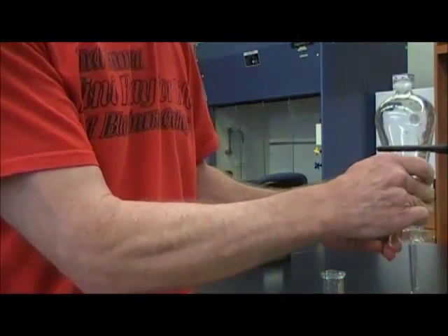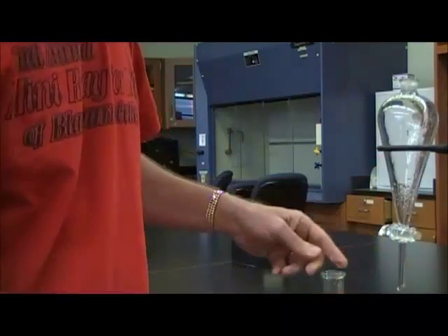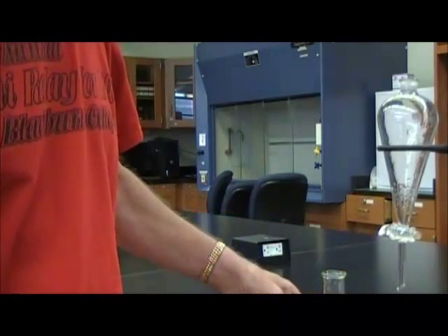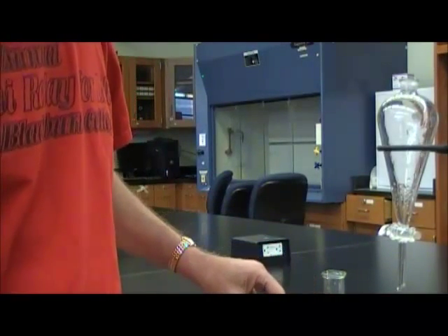And that reflected a separation between extracting the iodine from the water layer into a hexane layer.